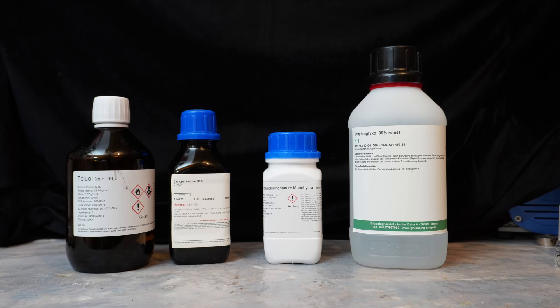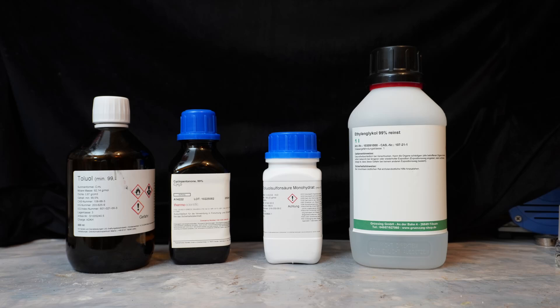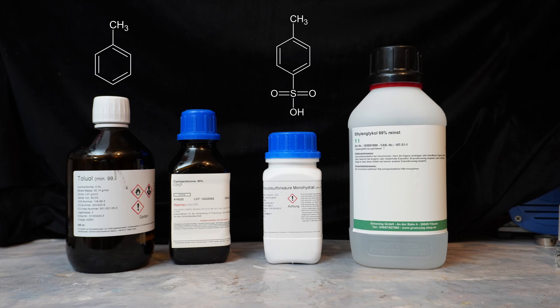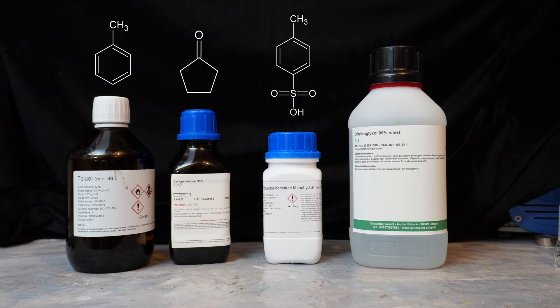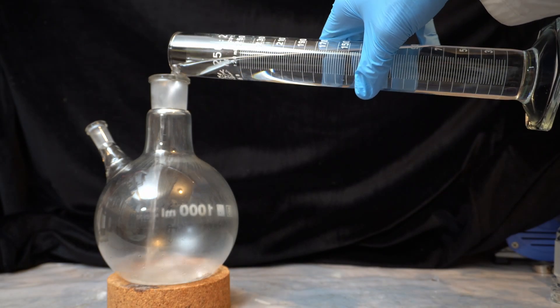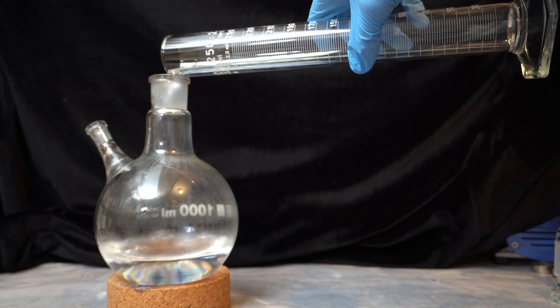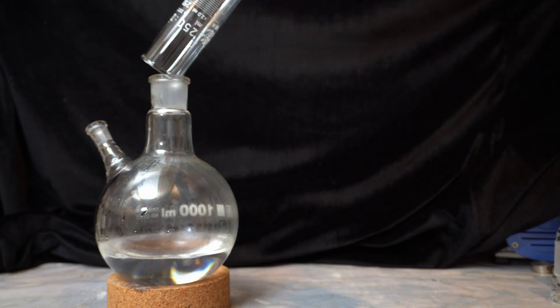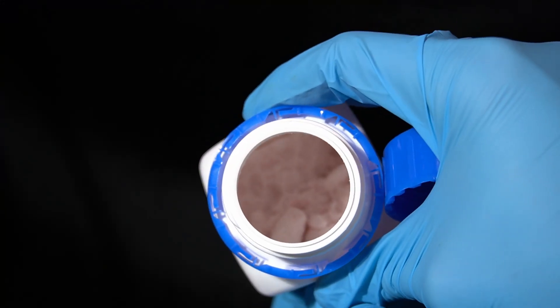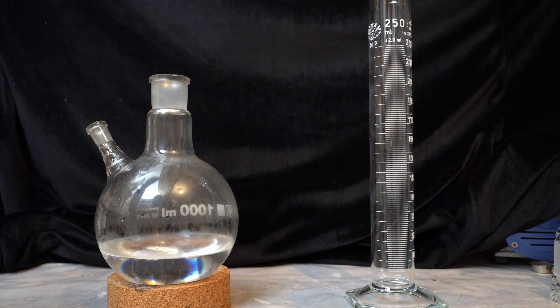For the reaction itself, four different chemicals are needed: toluene as a solvent, para-toluene sulfonic acid or PTSA in short as the acid catalyst, cyclopentanone, and ethylene glycol. I preload a one-liter round bottom flask with 250 milliliters of toluene, 0.5 grams of PTSA — which is pink for some reason — and a stir bar.